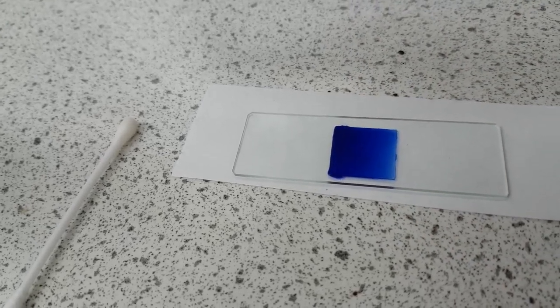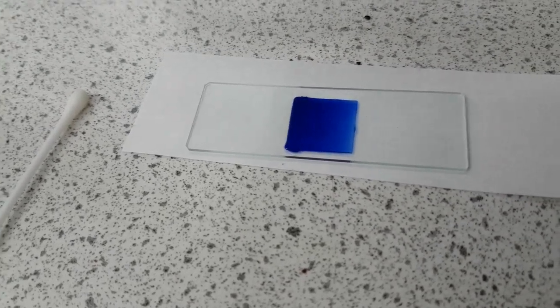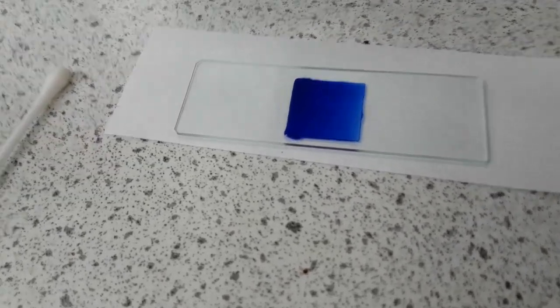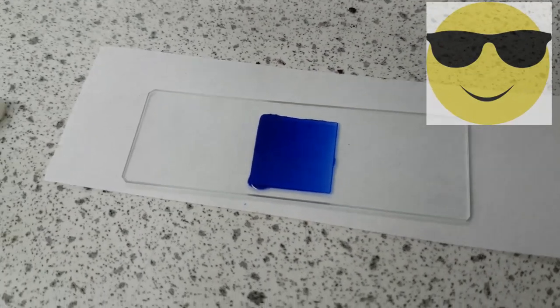Now that's actually not bad at all because what we're trying to avoid are air bubbles and literally I think there's no air bubbles. Oh my goodness that's amazing, one handed as well, check that out.